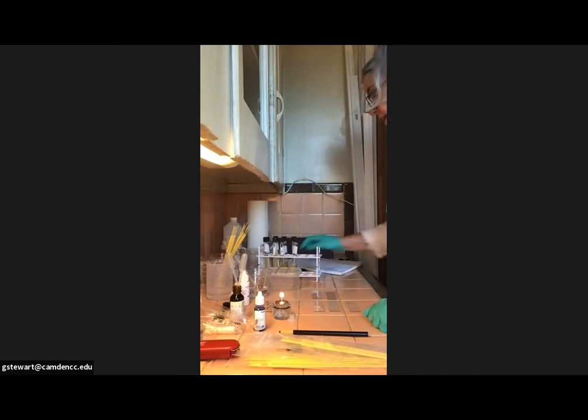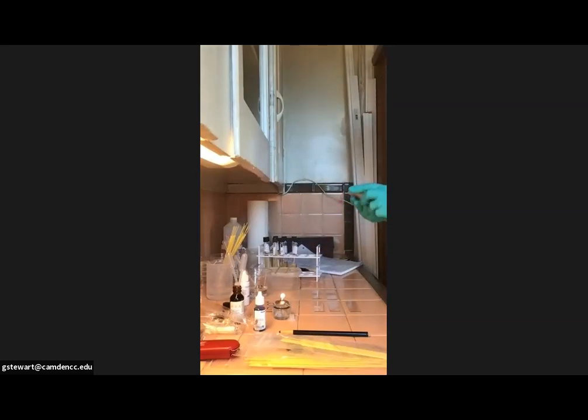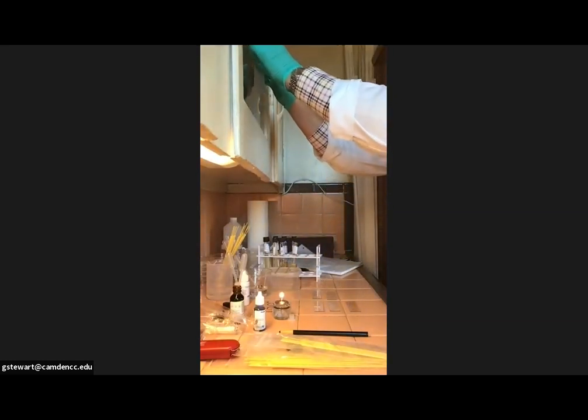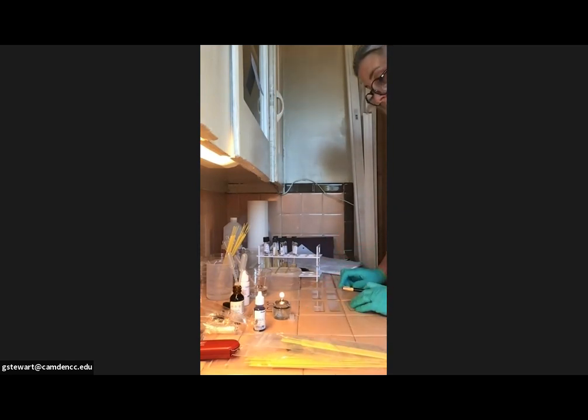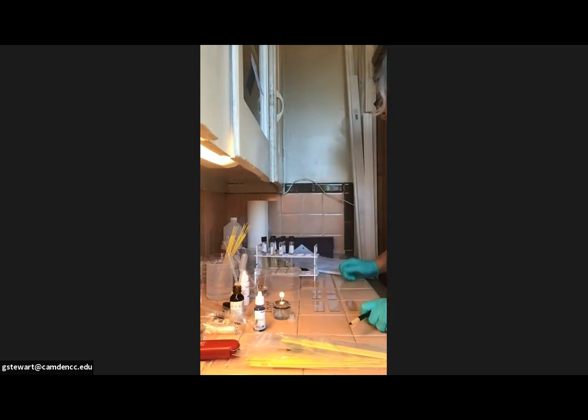I would also advise getting a Post-it pad and writing down the procedure for the gram stain in shorthand, which I have on my paper here, how much time for each stain. And then I would post this right in front of me so that all I have to do is look up when I'm in the middle of my procedure and not fuss around, looking at how long do I leave each stain or each decolorizer on the slide itself.